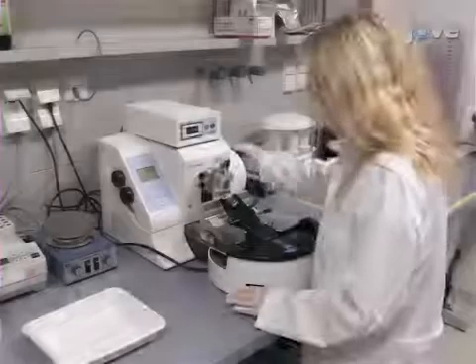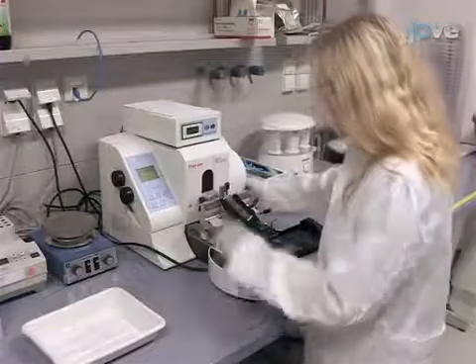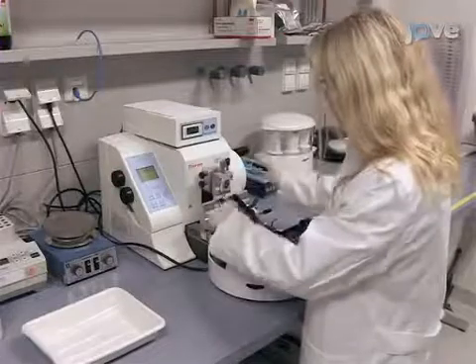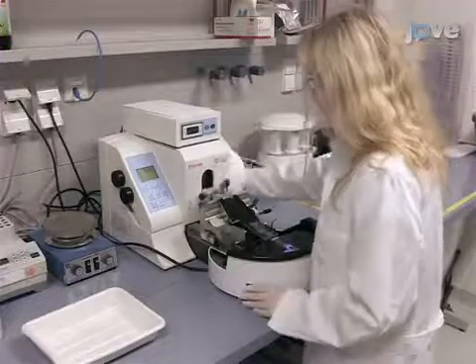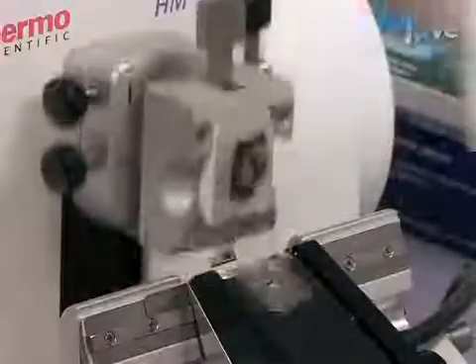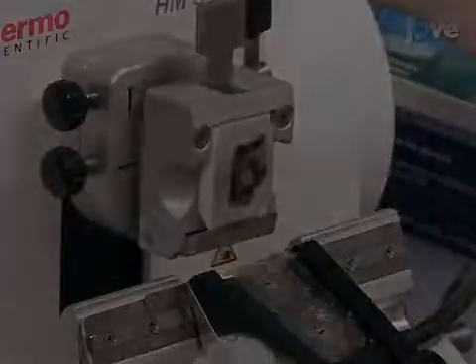To begin, prepare tissue slices for microdissection. Cut sections with a microtome. The thickness of the slices depends on the sample. Usually, microdissection works well with slices of 7 to 10 micrometers.